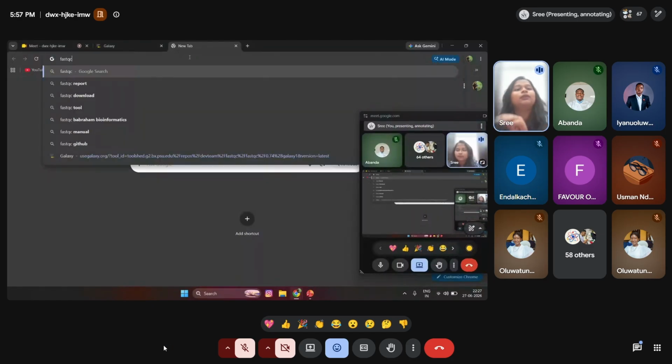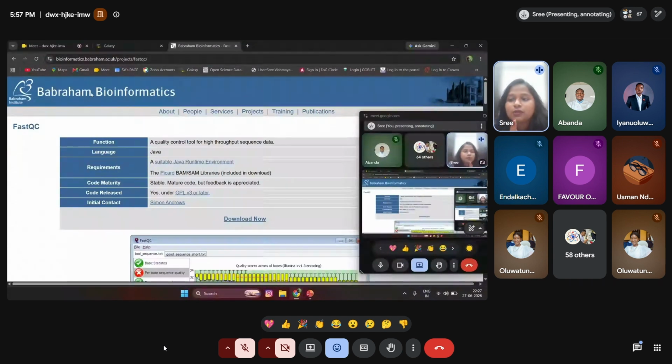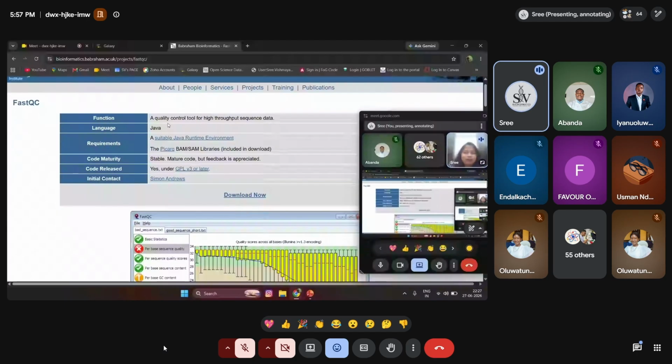If you go and check FastQC, the first thing you can see is FastQC, a quality control tool for high throughput sequencing, from Babraham Bioinformatics. They have introduced the tool, where you can see the basics of FastQC. It is developed in Java. Okay, no problem, we go slowly. FastQC is built in Java, so the requirement to install is to have Java running, and you can download it. The latest version is available if you want to download it.